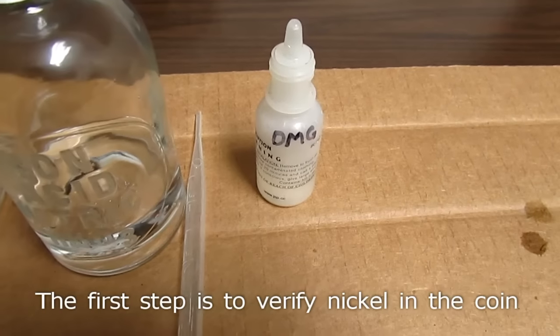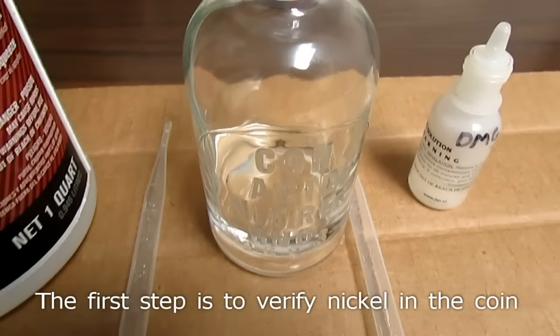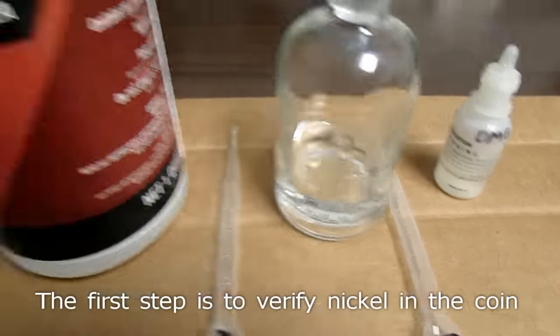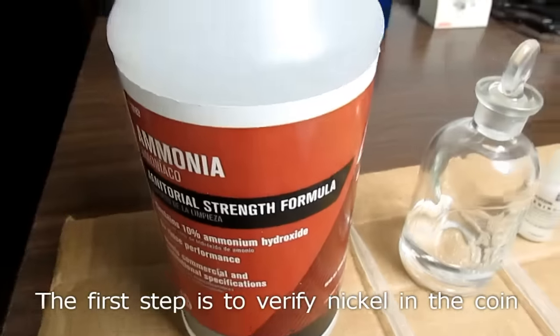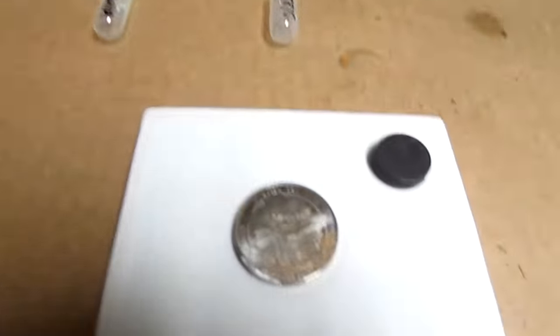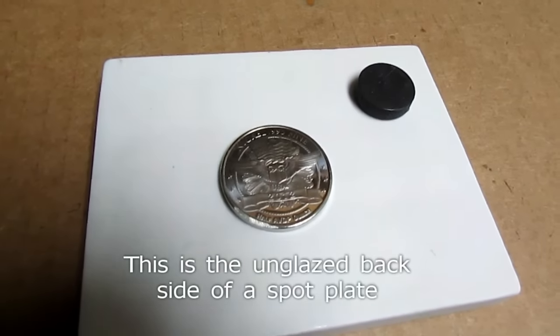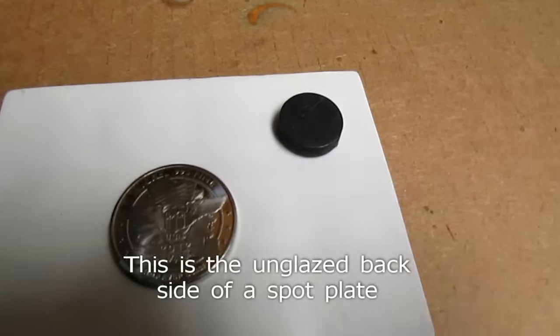I've got some DMG, some concentrated nitric acid, some household ammonia, a little spot plate here, and a pure nickel coin and a magnet.